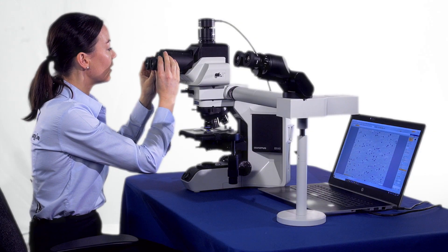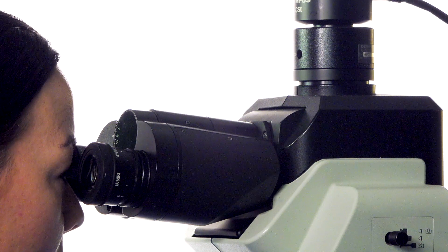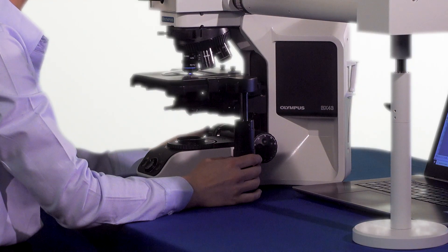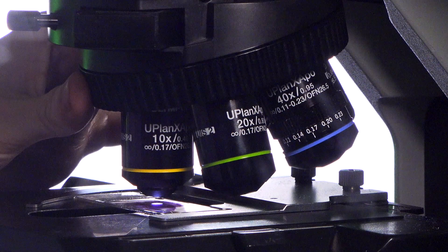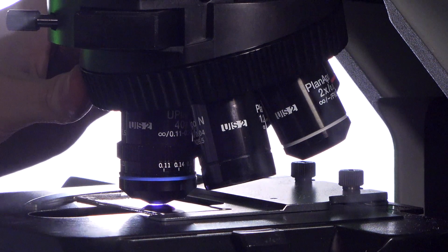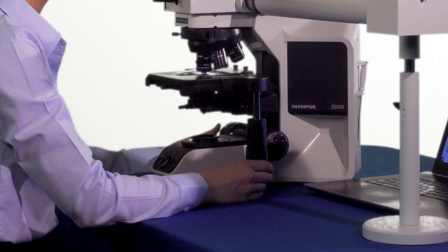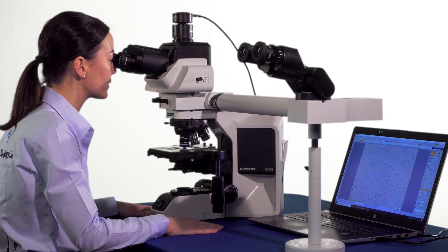Set the eyepiece to zero to get your main user in focus. Looking down the microscope and using the controls, go to a high-powered objective, something like your 40x objective. Focus on your sample until your image is in focus for your right eye. Once your image is in focus, don't touch any of the controls of your microscope.